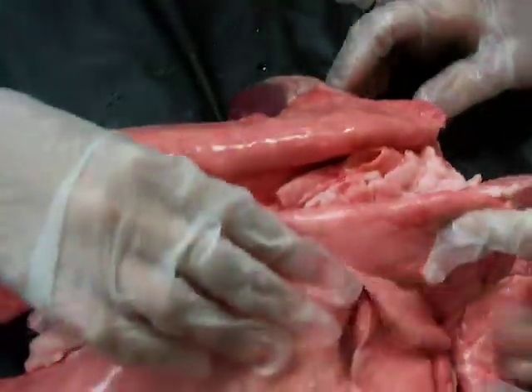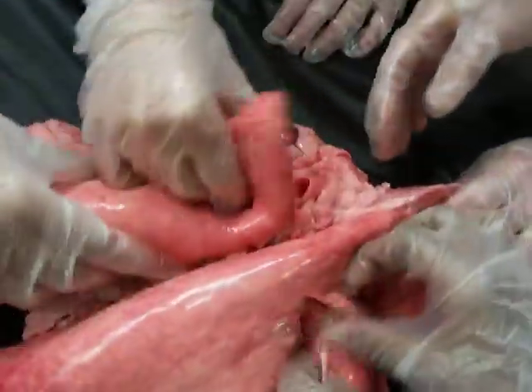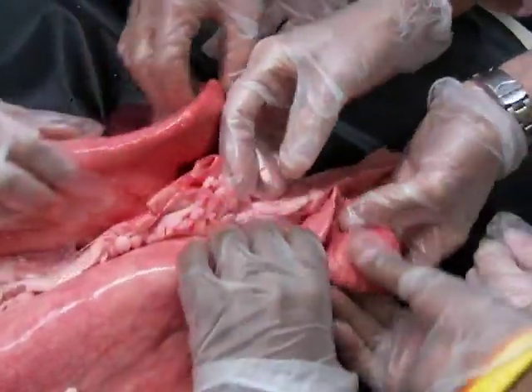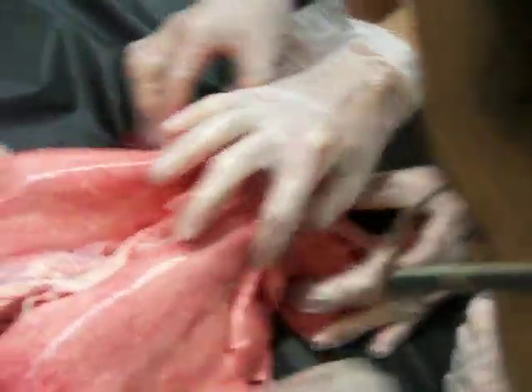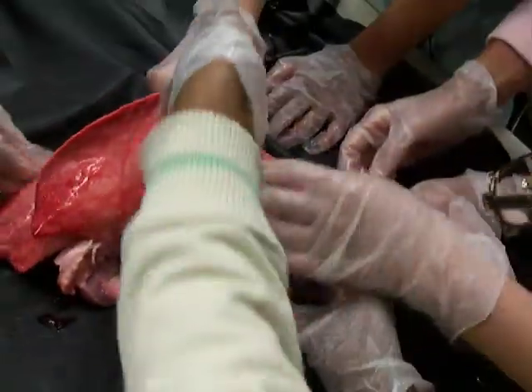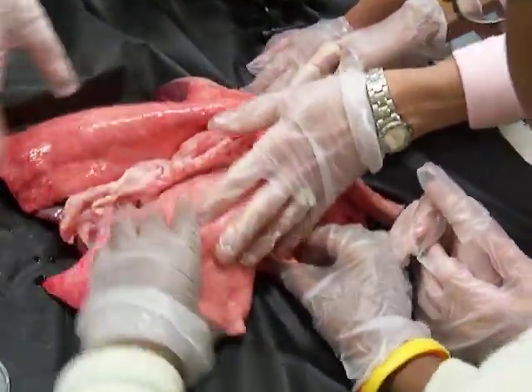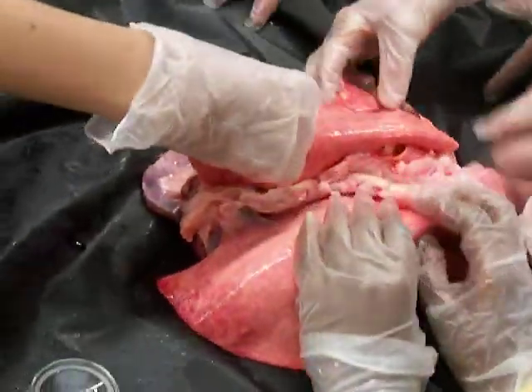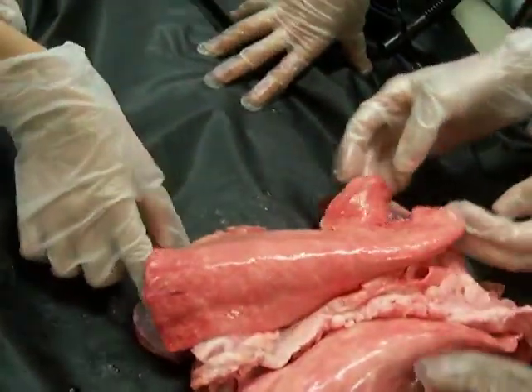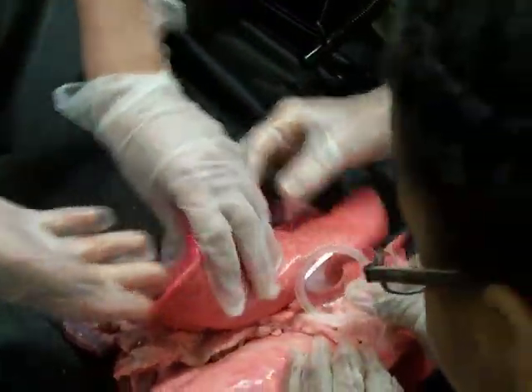Here's a lobe. This is going to be the left side of your body, so there should be four. Now they have this extra one — pretend that's not there. They have one, two — they have four. We only have two on that side. And then this side, they have one and two. Oh, that's so cool, that is really really cool.